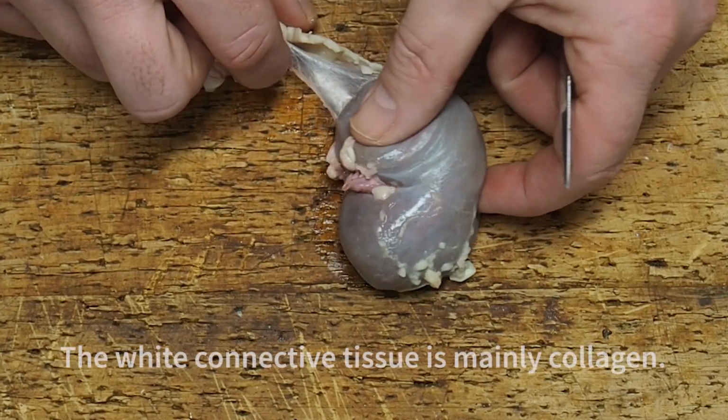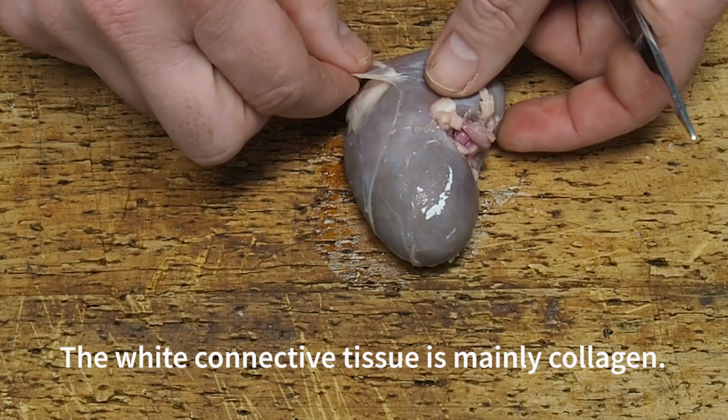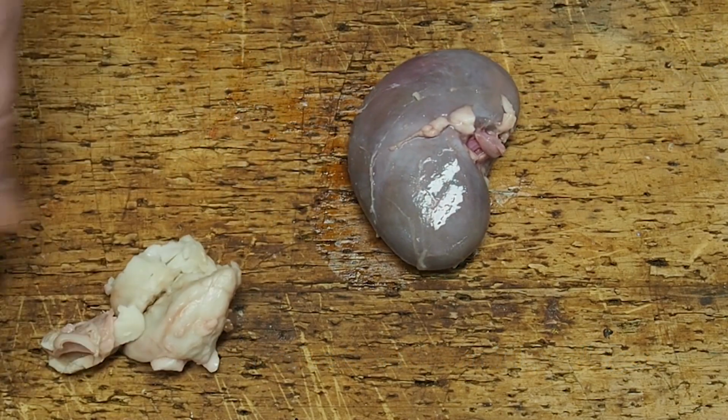Somewhere in there is probably the adrenal gland. And the white connective tissue is mainly a protein called collagen.